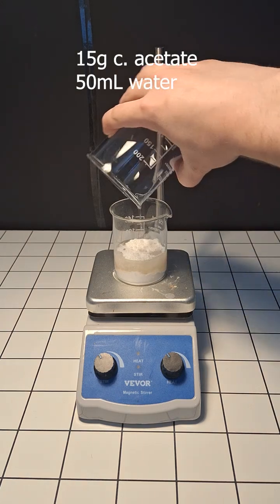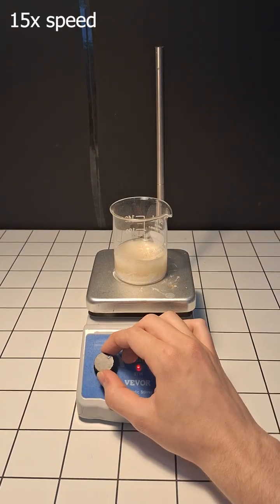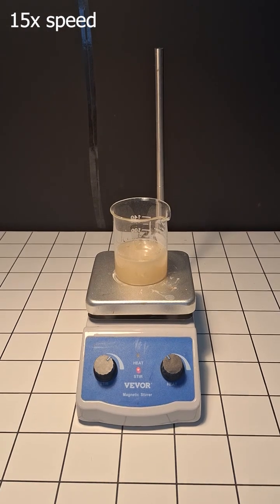The first thing that we have to do is dissolve about 15 grams of this stuff in 50 mils of water. What we're trying to get here is a concentrated solution, so some of it's going to be left undissolved.